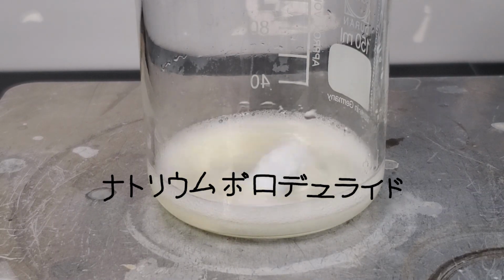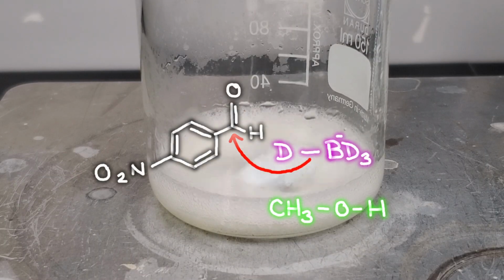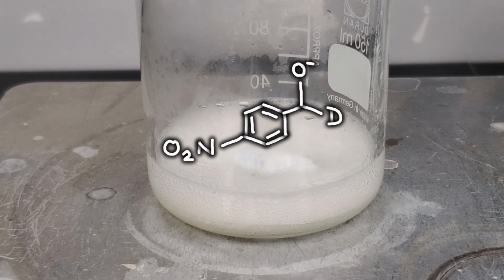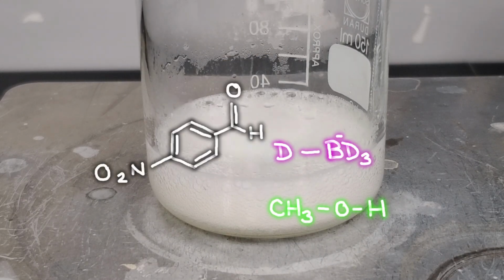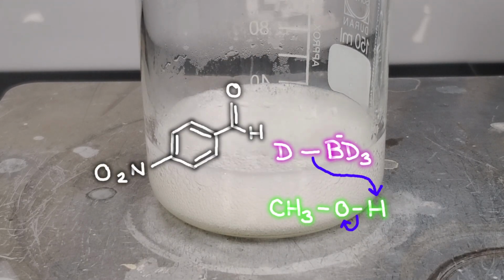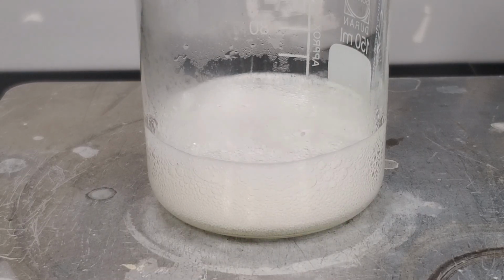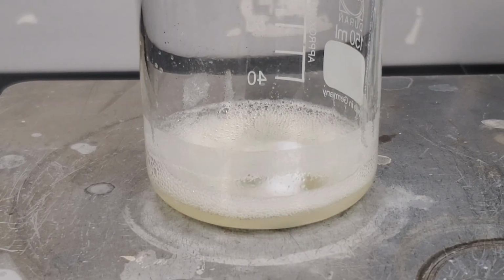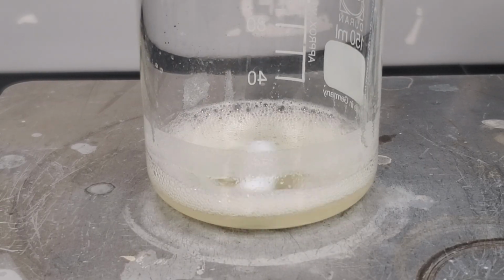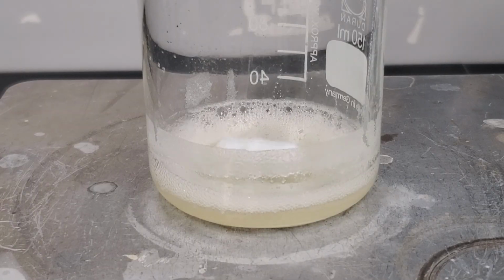Now two things are happening in parallel. Deuteride attacks the aldehyde carbon, forming this deuterated intermediate that will become the product. Deuteride also reacts with methanol, generating methoxyborate species like sodium tetramethoxyborate and HD gas. Because some deuteride is wasted on the solvent, I used an excess of sodium borodeuteride to push as much of the aldehyde to the product as possible.